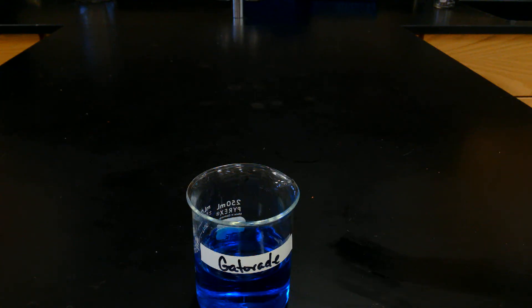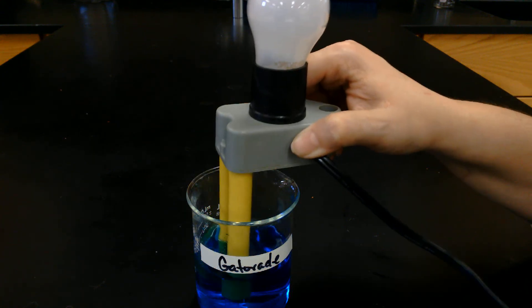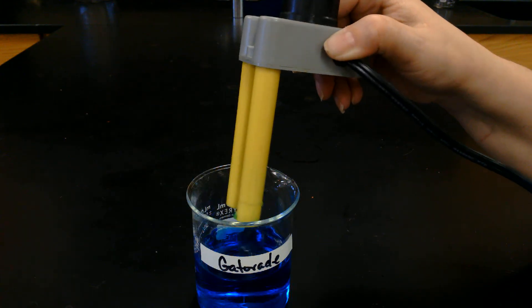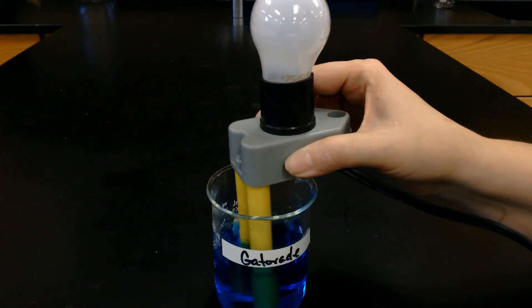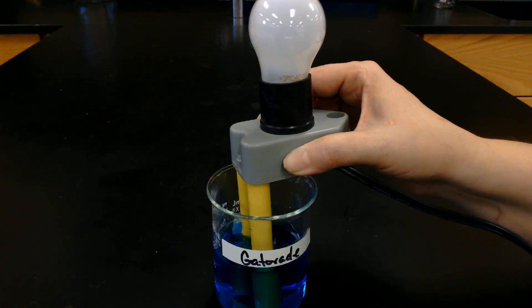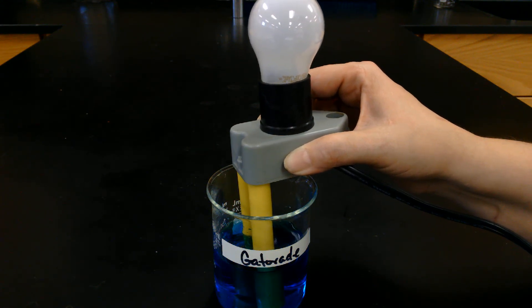Here's our last one — some good old Gatorade. Oh, what's going on there? It is weird. Maybe we should try some fresh Gatorade? I'm going to try that one more time just to make sure our tester is working correctly. All that advertising for Gatorade and its electrolytes — maybe the sugar drowned it out. Who knows? But it's not lighting up our little indicator. Go ahead and make your observations, then answer the rest of the questions on your teacher-made worksheet.